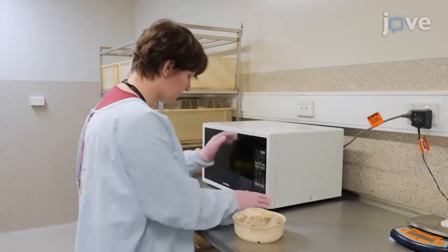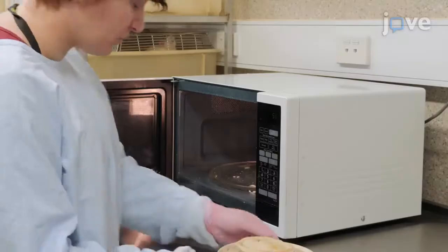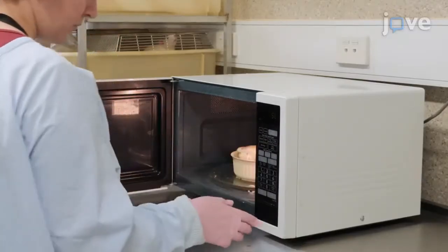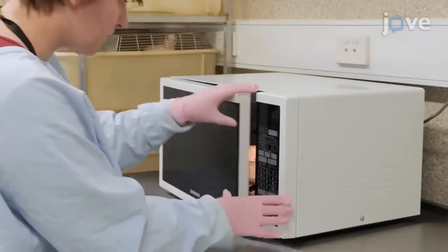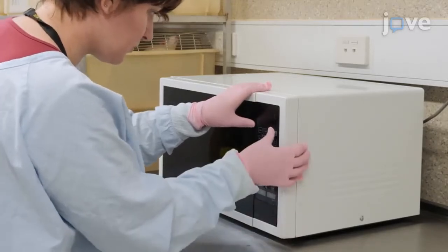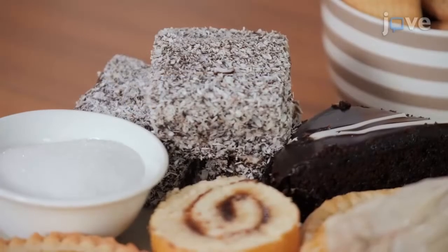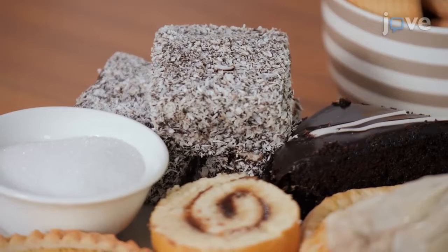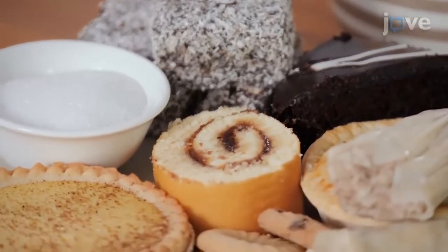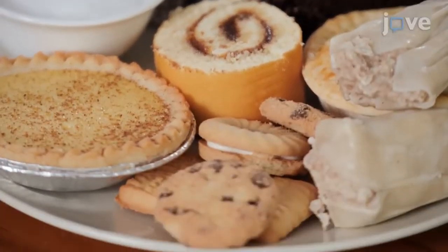To begin this procedure, obtain an appropriate amount of cafeteria food and thaw it 24 hours prior to use. Food can be defrosted using a microwave but should not be presented while hot. Changing the type of cafeteria diet foods offered daily ensures that variety is maximized and cage soiling is minimized.